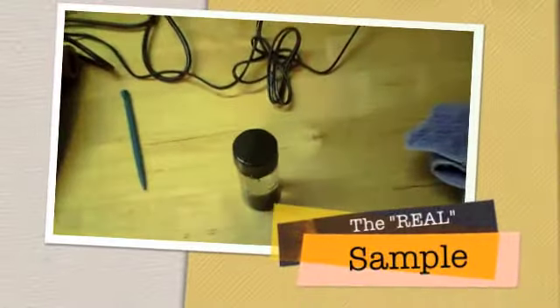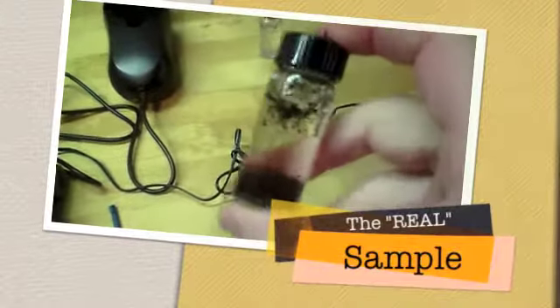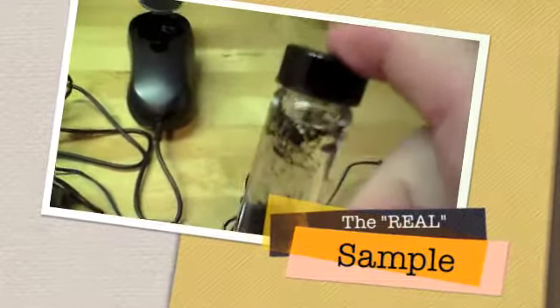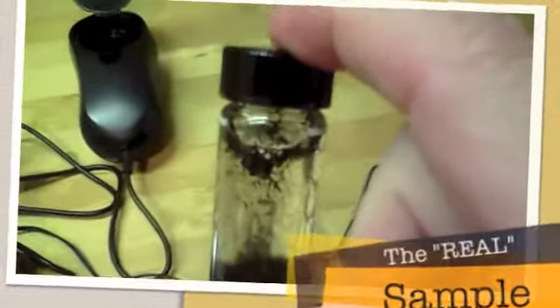Okay, I have prepared my other sample. Really, all I did was I got some dirt from a flower pot and put it in with the water. But you're going to use your sample that you've been given to test the turbidity.